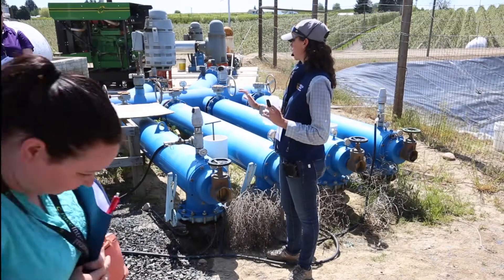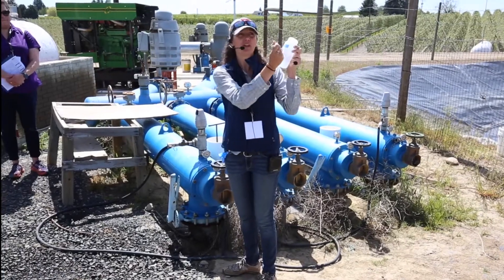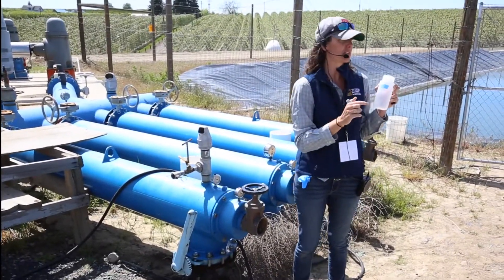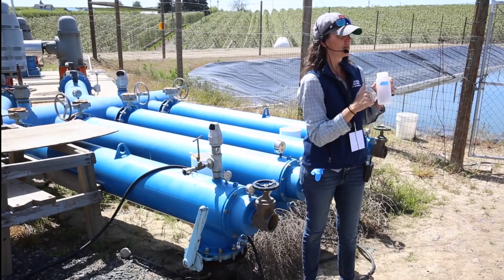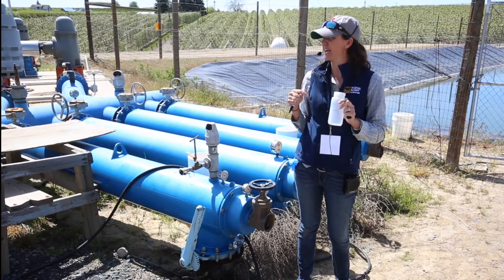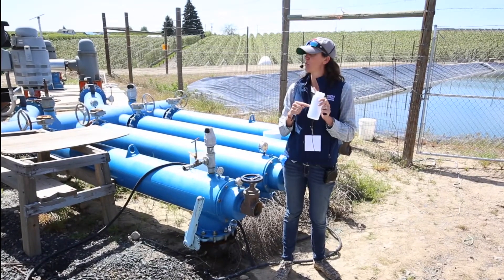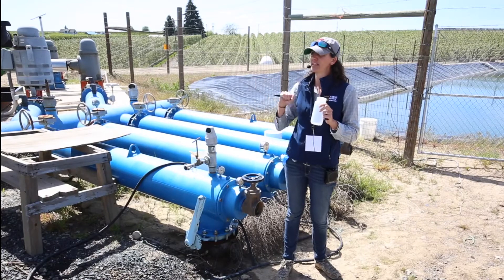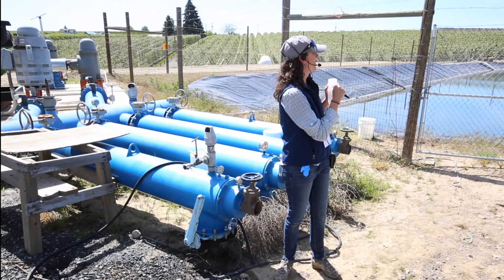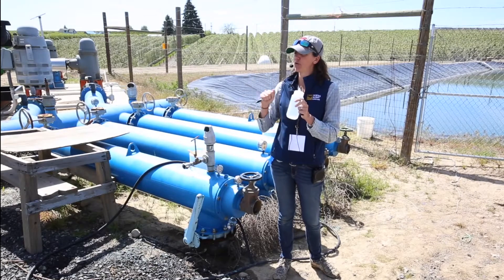So the first thing we do when we come out here: we know where our sampling location is. We've got our sample bottle and our Sharpie. We're going to write down our information on our sample. There are five pieces of information that are good ideas to put on your sample bottle: your sample identifier — the most important thing, a code or name you've given it — the date you took it, and your initials. If there's room, also write the time you took the sample and the ranch identifier, like block 32. On small pieces of tape or little bottles, you might not fit all five, but those first three — identifier, date, and who you are — are essential.